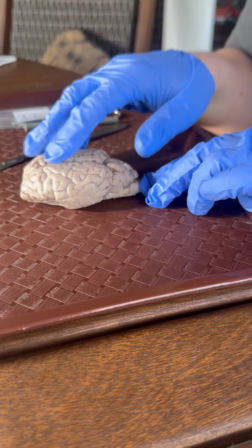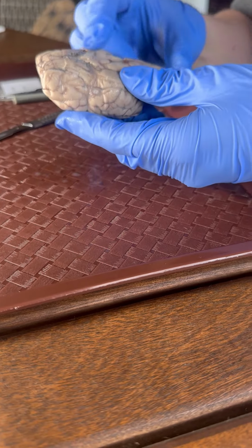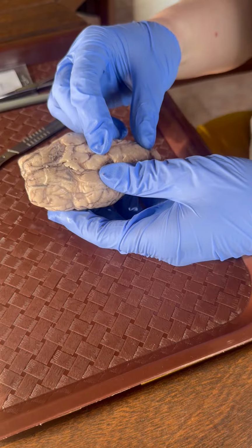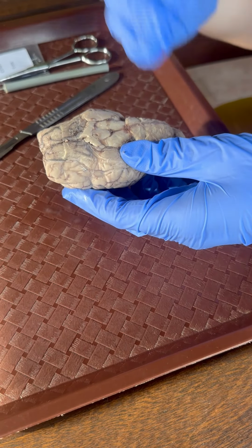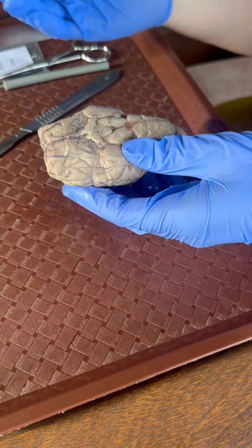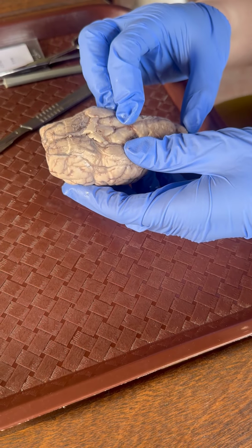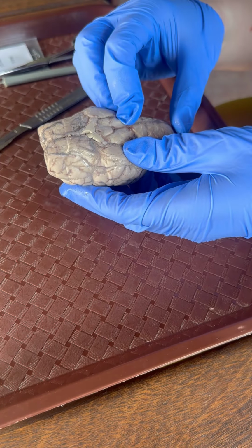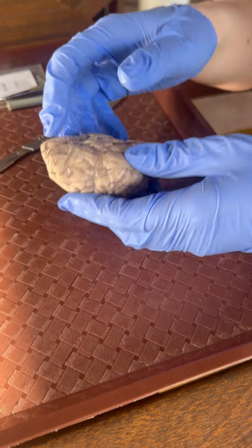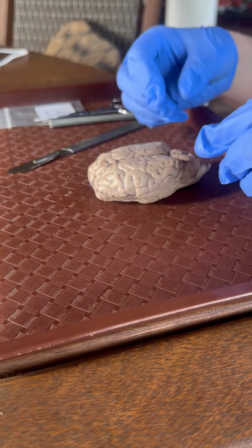And then when you flip the brain over, the spinal cord then goes into the brain stem. So this whole area right here is the brain stem, and that controls the flow of messages from the brain and to the rest of the body and back and forth. So this is a vital area of the brain to communicate what needs to be done throughout the body. Then if I flip it back over here, we can see the cerebrum.